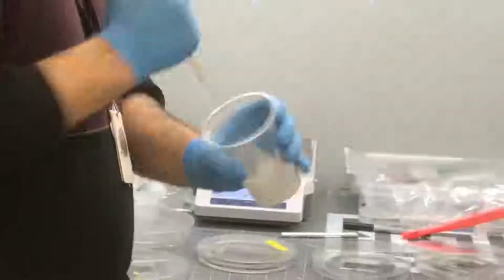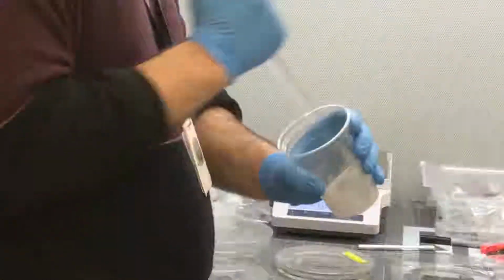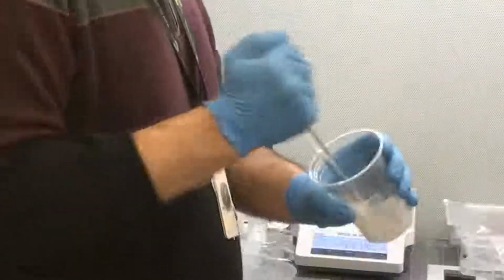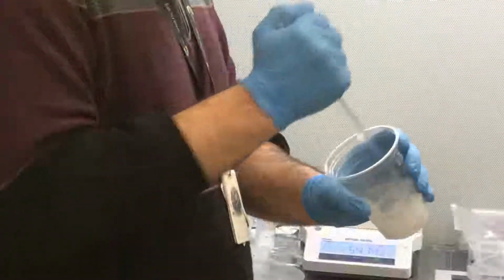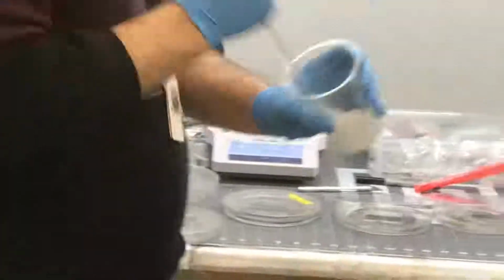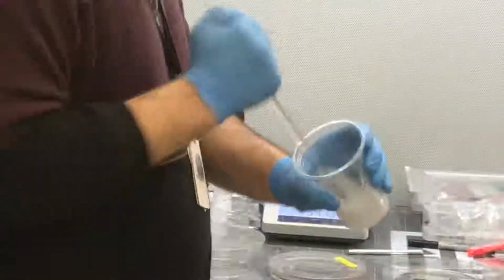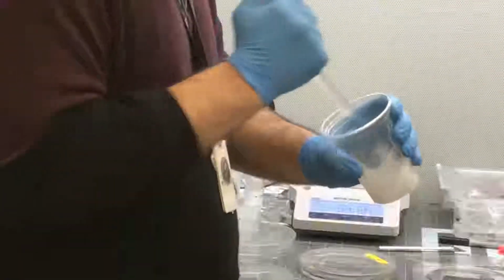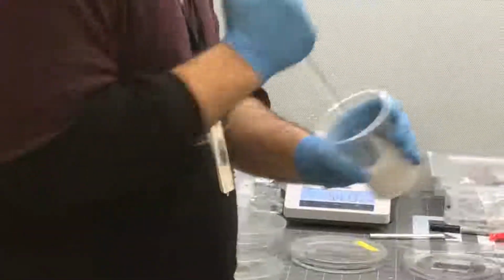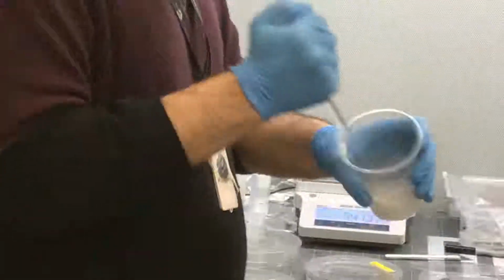Normally, this mixing depends on the hand also. For example, based on my experience, it takes 2 or 3 minutes for this. If you stir slower, you need more time to mix. So it depends on the speed of the stirring. If you do it faster, surely the time is less. Is it possible that when you are mixing at this speed, the glass cup breaks? No, this is not glass. This is just plastic. Okay.